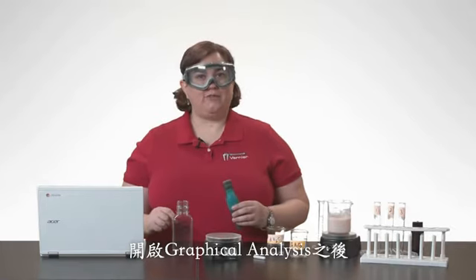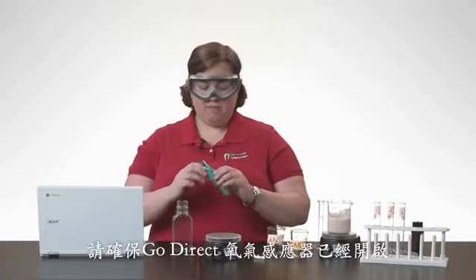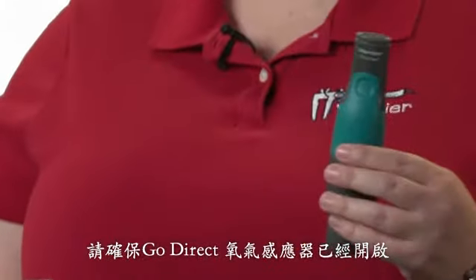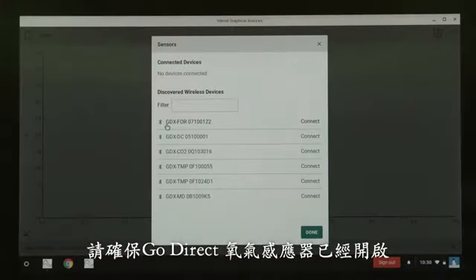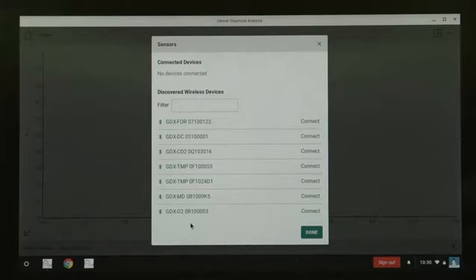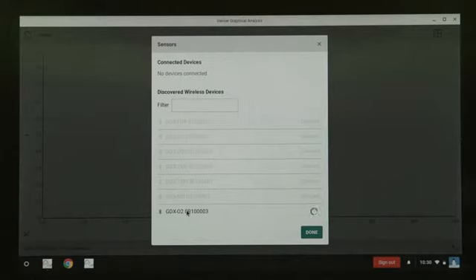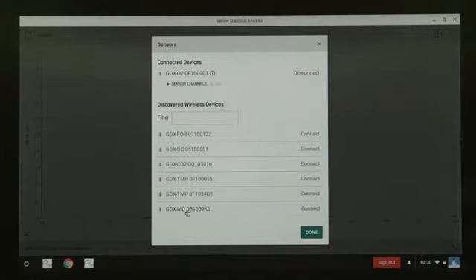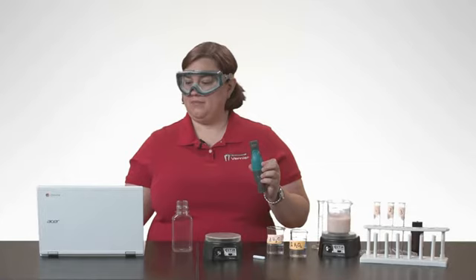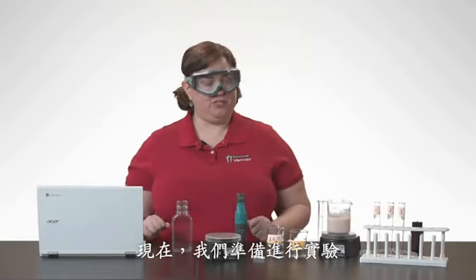Once you've launched graphical analysis and then click or tapped on Sensor Data Collection, make sure that your Go Direct oxygen gas sensor is on. And then you're going to look for it in your list. Once it shows up, you're going to click or tap on it to connect. Once it's connected, you can then click or tap Done. And now we are ready to set up our full experiment.